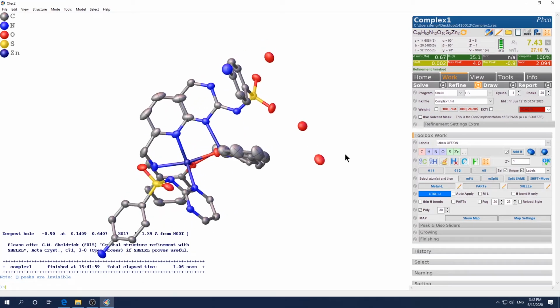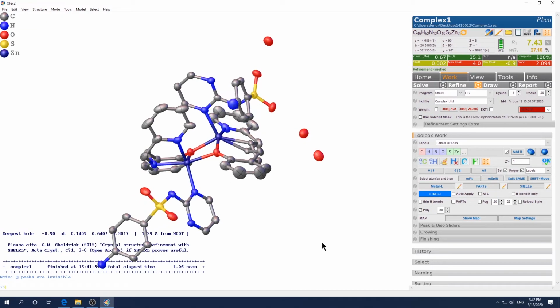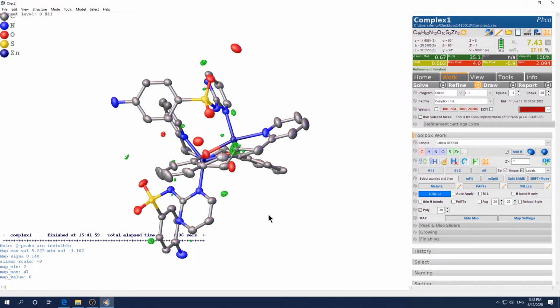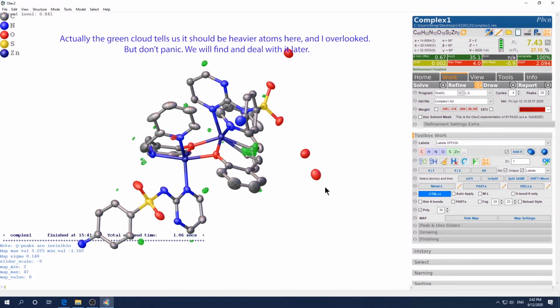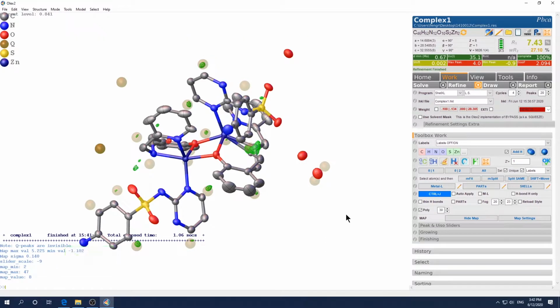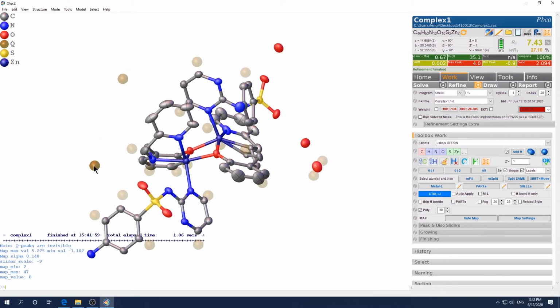So let's make sure the major model part is correct. Let's see the nitrogen are assigned correctly. Yeah, generally looks fine. There are some extra electron density here, but not too outrageous. Yeah, good. Okay, what I'm going to do is Ctrl Q to bring up the Q peaks and Ctrl M to eliminate the maps. And again, this is one big Q peak there. We will worry about that later.